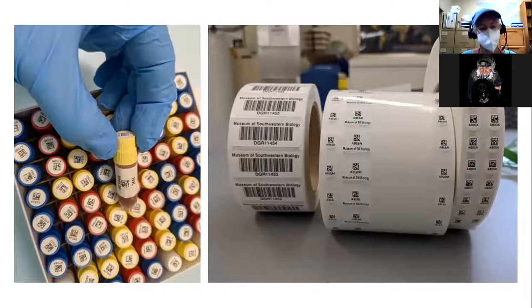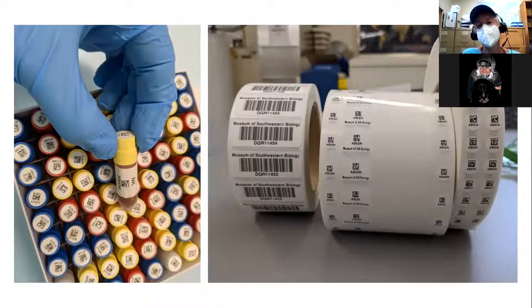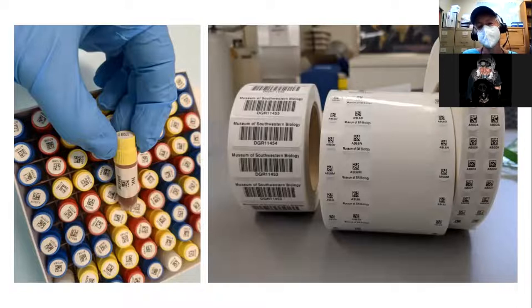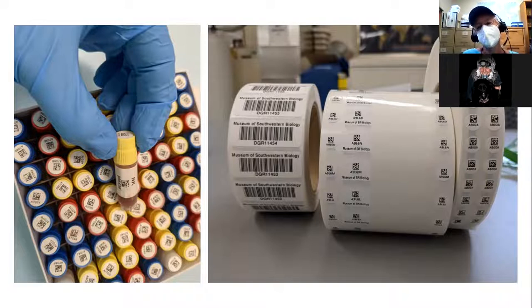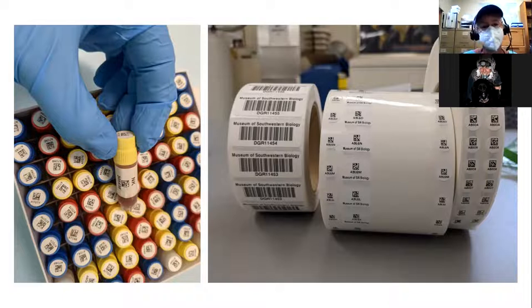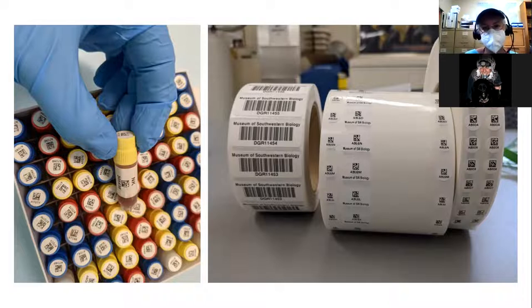Once you add that barcode to the part in the catalog record, the linkage is created, but these databases can operate independently. It's very useful when you're working in the field and want to identify a particular sample, track it through time, and keep the linkage with its host or source data. We have three different kinds of barcode stickers: one applied to a freezer box, one in the middle with three identical base-36 barcodes that can be printed small requiring 2D scanners — one can go on a data page, the wrap-around can go on a cryo vial — and a third that can also go on a cryo vial or field catalog page. We also have printed stickers with different identifiers that we scan into position in a box.